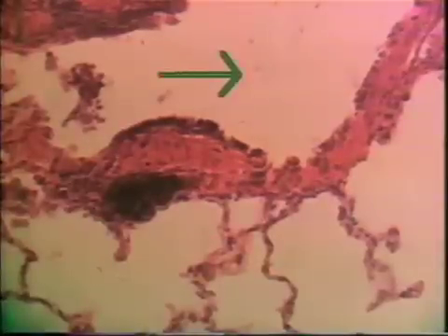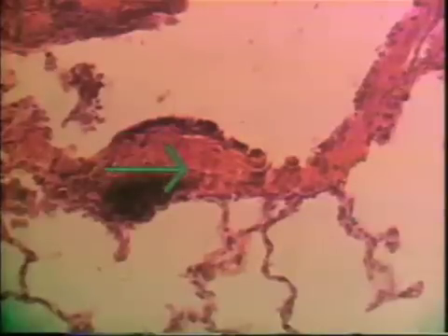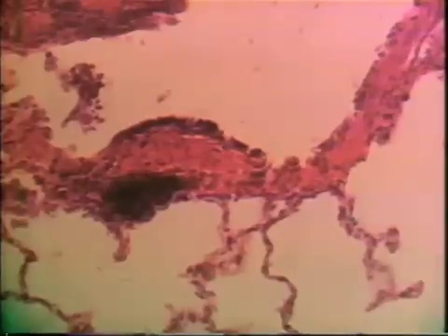At higher power, this is the lumen of a terminal bronchiole. Notice this is a simple columnar epithelium — it has cilia but there are no goblet cells. Notice also this bundle of smooth muscle. Relative to the size of the lumen, there is more smooth muscle in the wall of the terminal bronchiole compared to the other tissues of the conducting system. So we have a simple ciliated epithelium without goblet cells and a lot of smooth muscle.